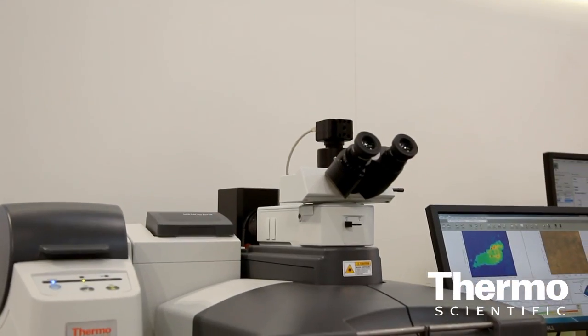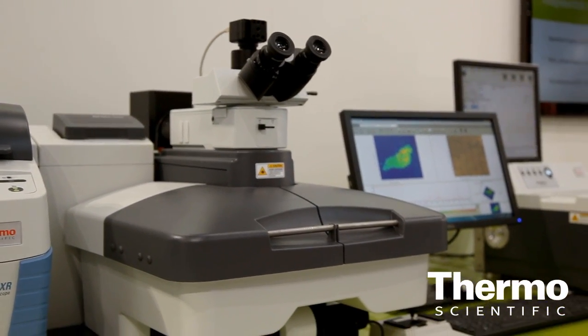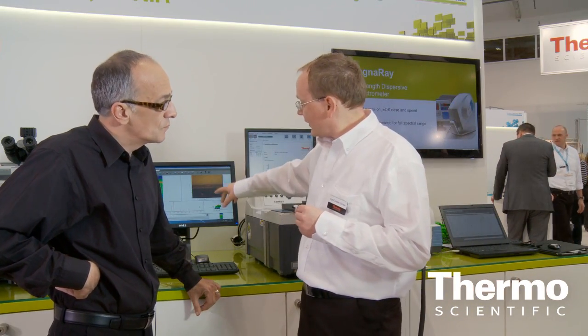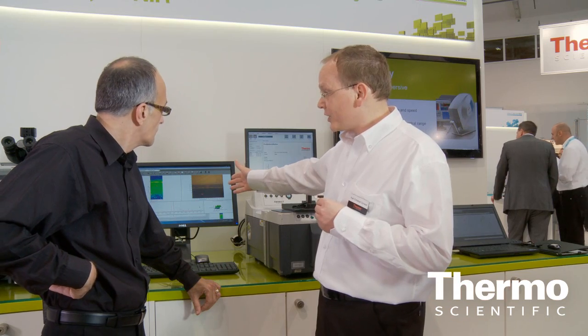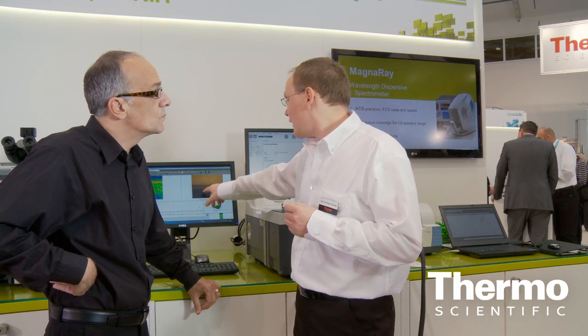It's point-and-shoot measurements, but you can also measure very large areas. You can measure in area mapping mode, as displayed here. You have a cross-section from a multi-layer system, and so you can identify each layer. You can say layer one is such a polymer, layer two is such a polymer, and so on. It's very easy with such a Raman instrument.